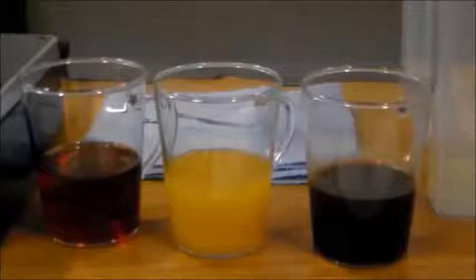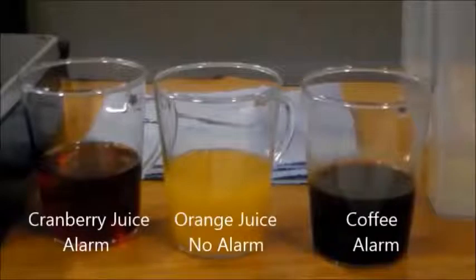What we expect is to see that a contamination with orange juice then does not trigger a new alarm, but that the contamination with coffee and cranberry juice is going to trigger an alarm.